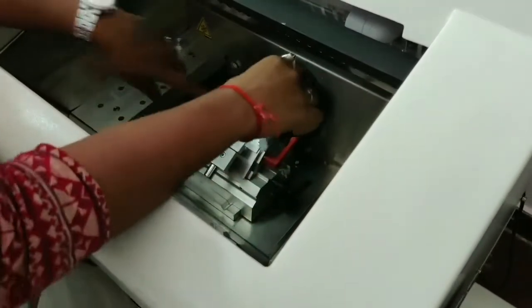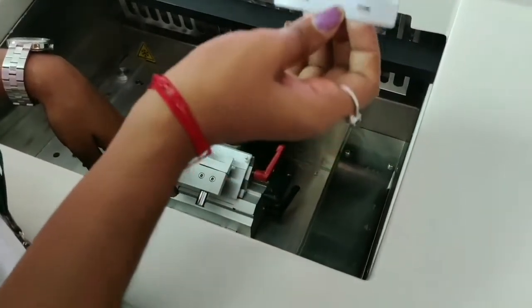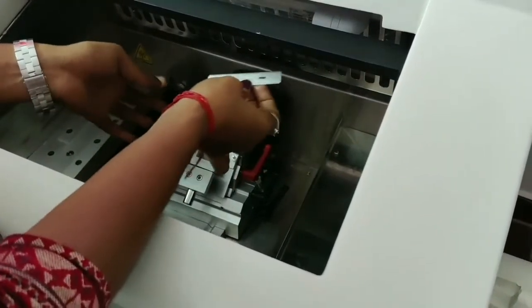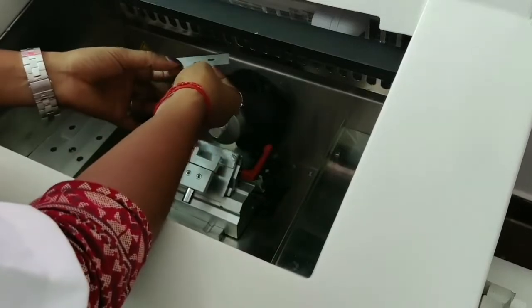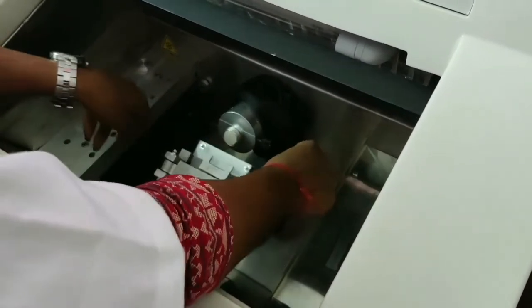In order for the cutting, the blade should be at the same temperature as the tissue. So we will put this blade also here itself in the workspace, so that it comes down from normal to frozen temperature, minus 10 degree centigrade, so that the same temperature will be maintained for the mold and the blade, so that the cutting will be easy. If it is at room temperature, it will definitely melt the solution. Now I put the blade. This is the adjustment knob for the blade. Here I put the blade, and now I adjust.